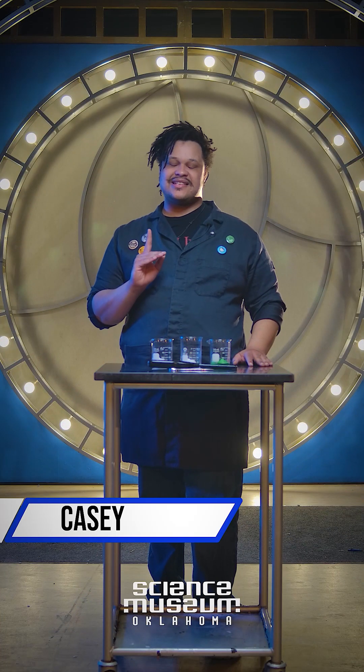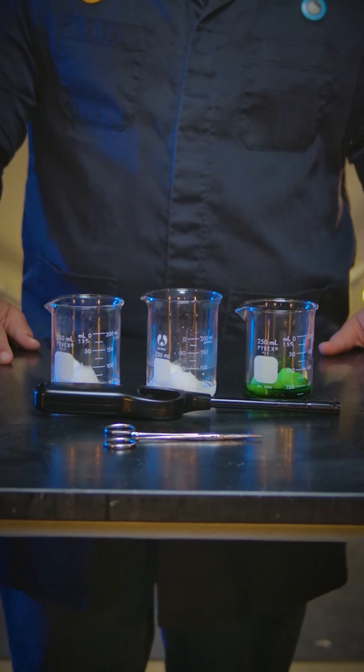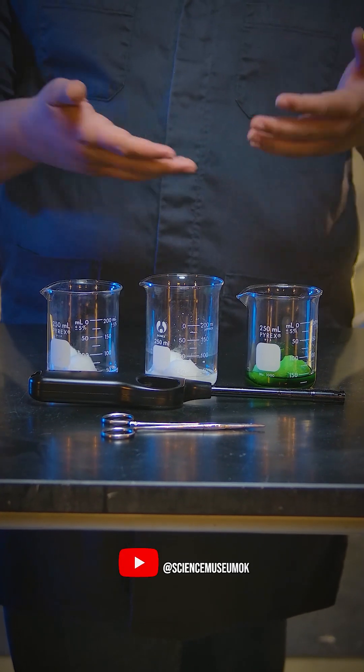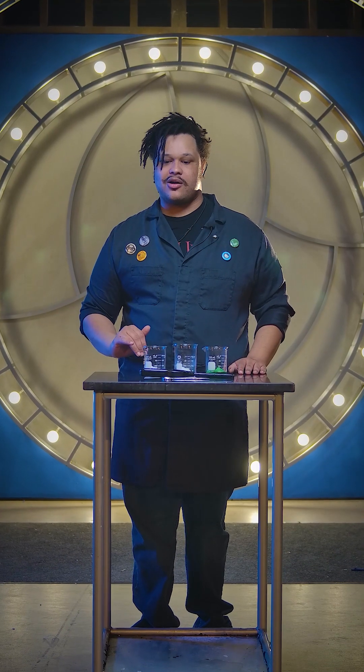Hi there, I'm Casey and today we are talking about the atomic spectrum. In order to properly demonstrate the atomic spectrum, we have these three beakers in front of me. This one is our control - it just has denatured alcohol.